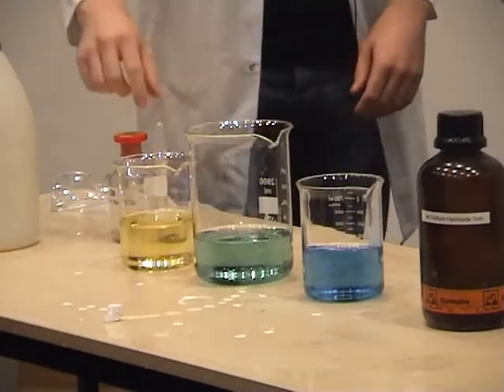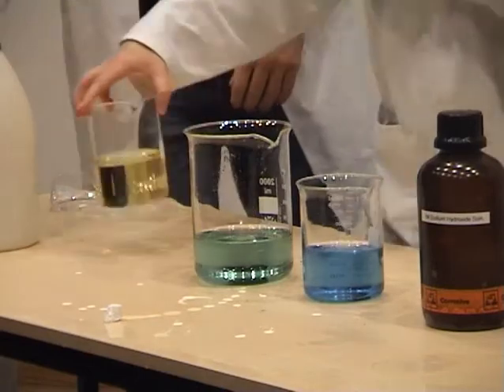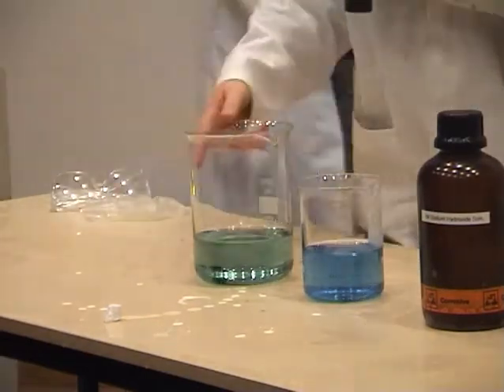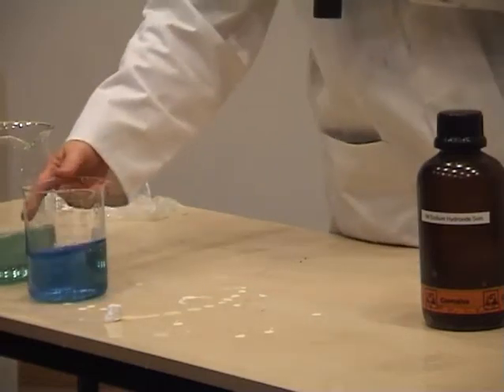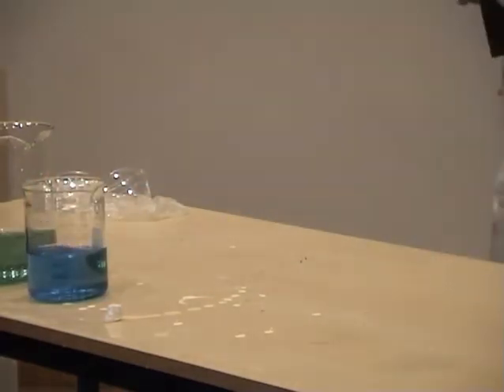To let you know which is which. The acid is giving us a nice yellow colour and it stays and it behaves itself and no changes. And the base has given us a nice blue.